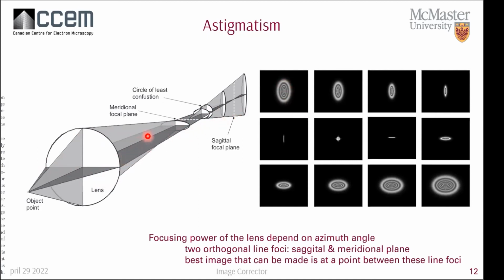You can see here that as you change focus, your ellipse is going to go this way, in the X direction. You come to the point of least confusion, and then you change the focus, and the ellipse converts to be oriented along the y direction. So as you change focus, the orientation of these ellipses changes. That's one way to tell if you have astigmatism: if you change your focus and the image stretches in one direction, and you go through focus and it stretches in the other direction, that's a clear sign that you have a little bit of astigmatism.